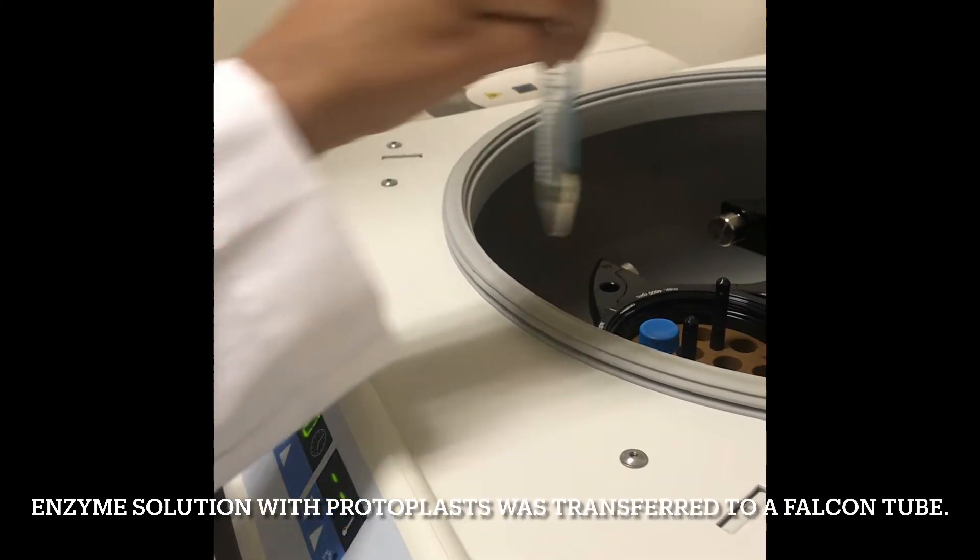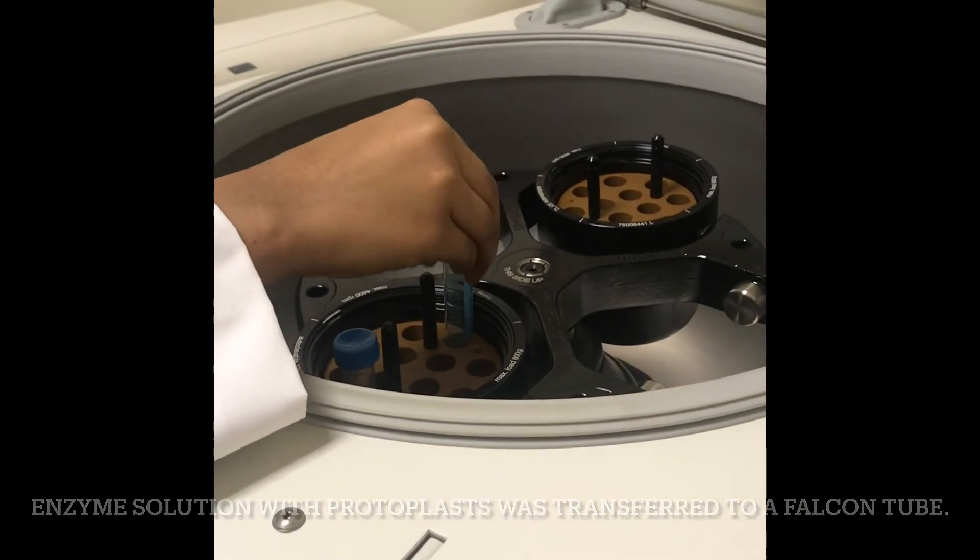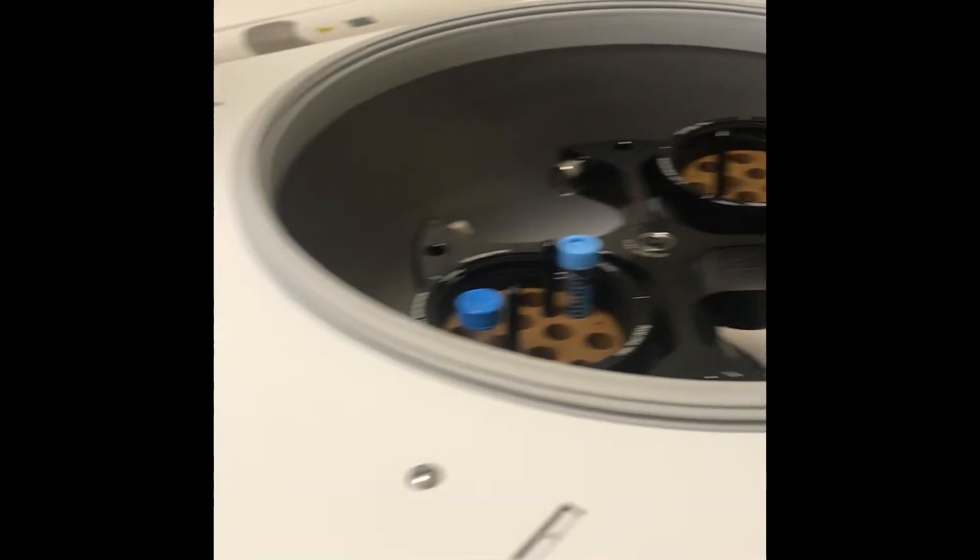So now we're going to centrifuge our protoplasts at 100 g for three minutes.